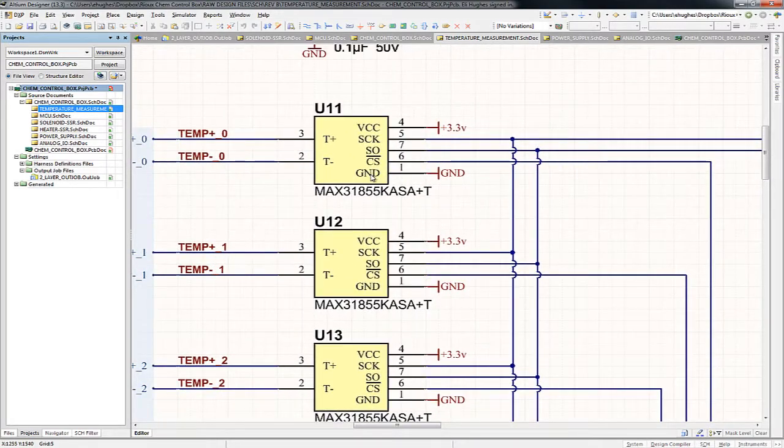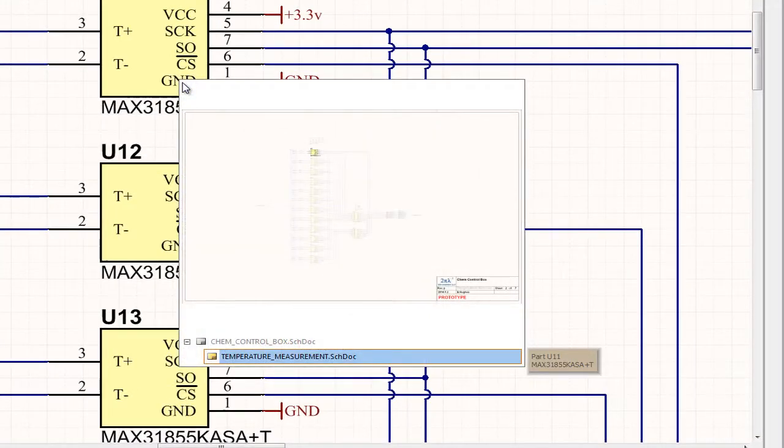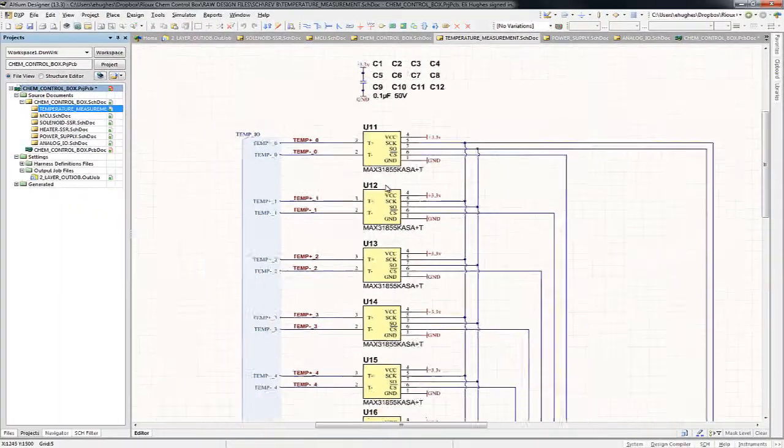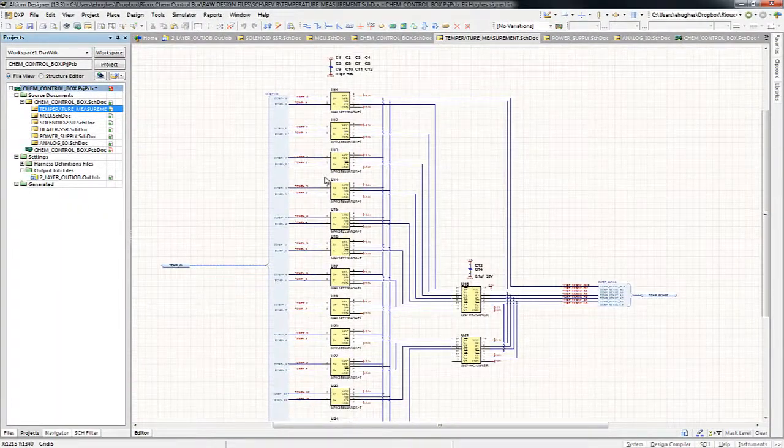Now from the user perspective, once again, you don't need to know much about them other than there's a driver for them. I'm going to make a different video that will cover the software, but I provide you a nice C function that'll be as simple as get temperature, and it has all the low-level code to read temperature. But I just want to make sure you're aware that's what's providing the temperature input.